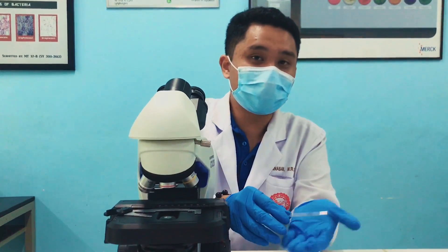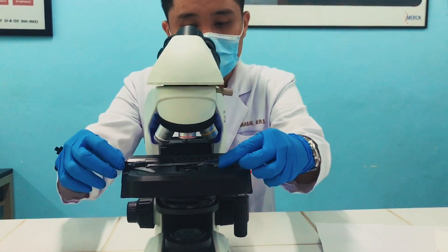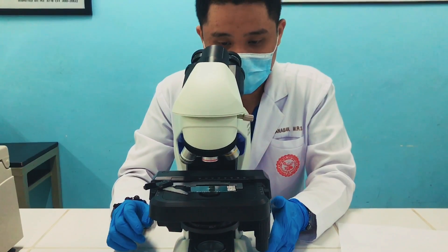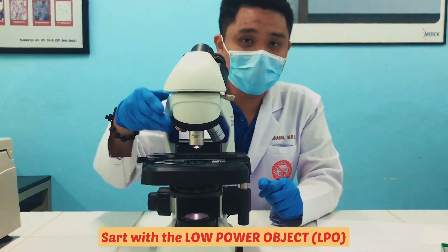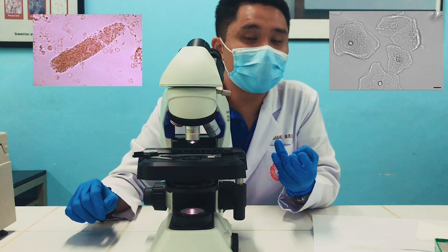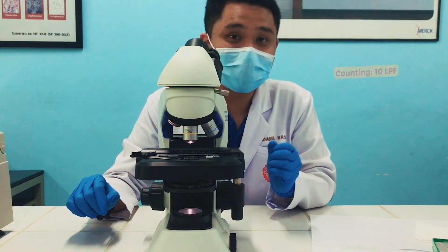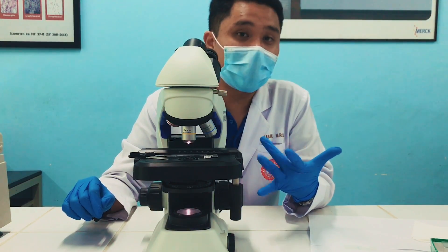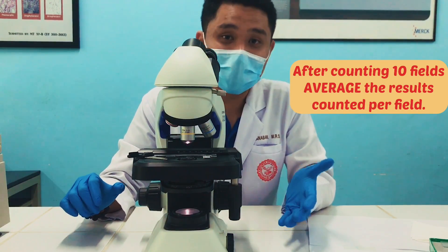Since we have already created our smear to be examined under the microscope, the next procedure is to examine it. Make sure your microscope has been plugged in and turn on your light source. We'll start with the low-power objective. Under the low-power objective, the sediments to look for are your casts, squamous epithelial cells, amorphous materials, and mucus threads. Scan at least 10 low-power fields, counting how many casts, epithelial cells, mucus threads, and amorphous materials are in each field. After scanning 10 fields, we'll do an average, and that will be our final report.